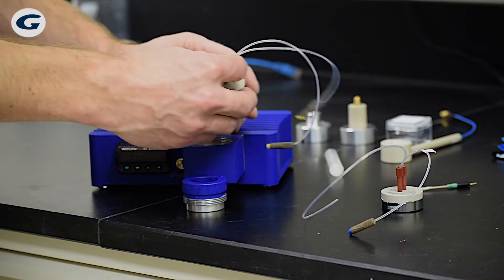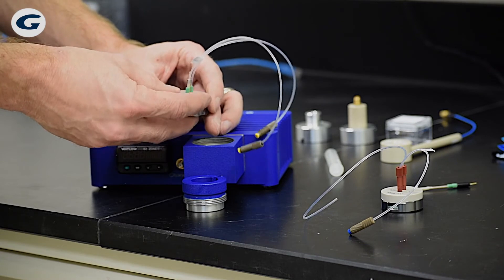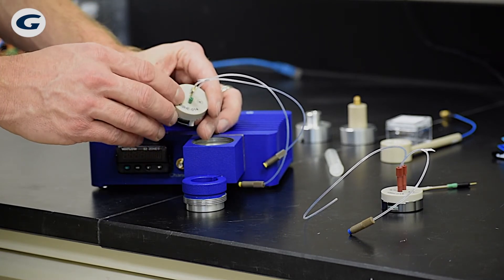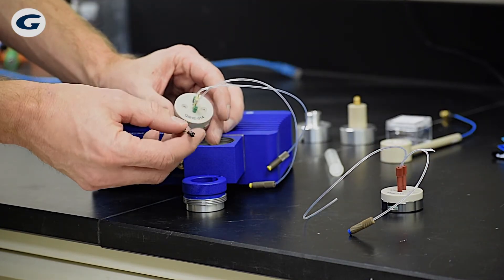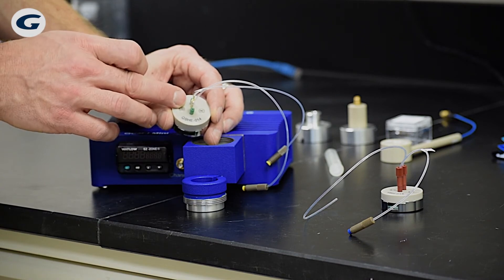We can do the same with the electrochemical flow cell module. Now the crystal is already mounted in here and screwed in. We have a platinum counter electrode right here, and then you would also have a screw type reference electrode that gets screwed into the hole next to the platinum counter electrode.